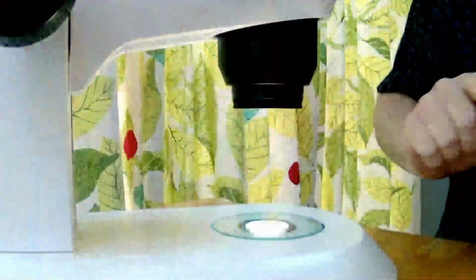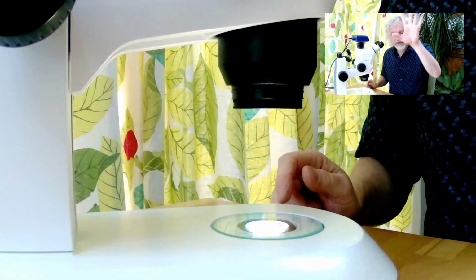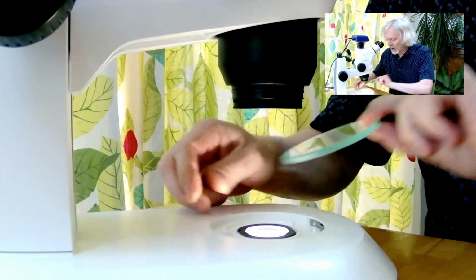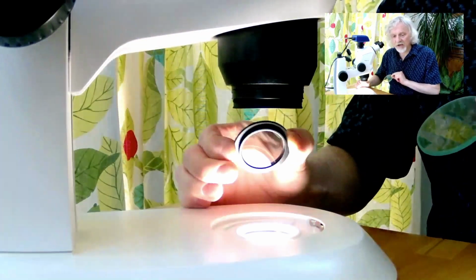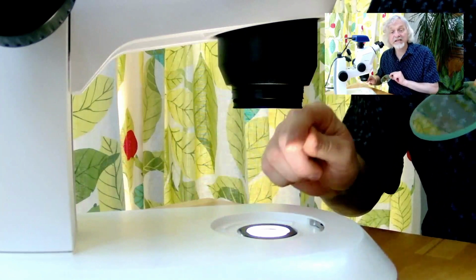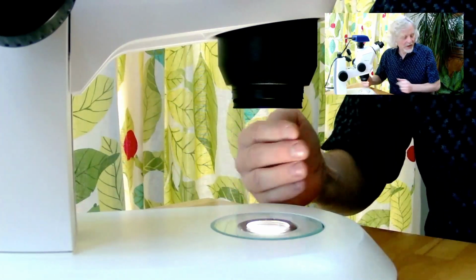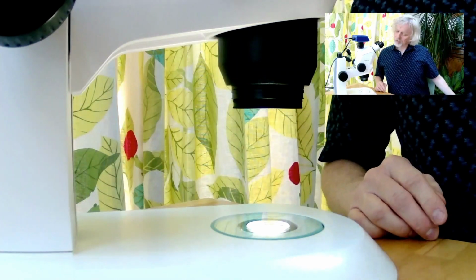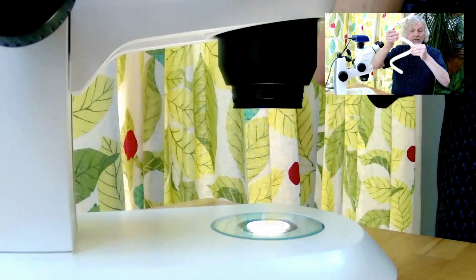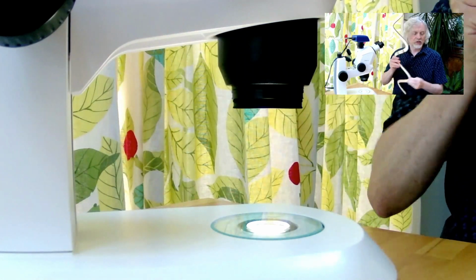I'll show you if I do this. I'll put myself in the top corner there like that. So I'm still here, and here's the microscope. Now, this is the light source. Underneath here, I have a filter which sits on there, and that is a piece of polarizing material. So the light that's coming through there, he says checking, it's coming through only like this, okay? So it's going in that direction and not in that direction.